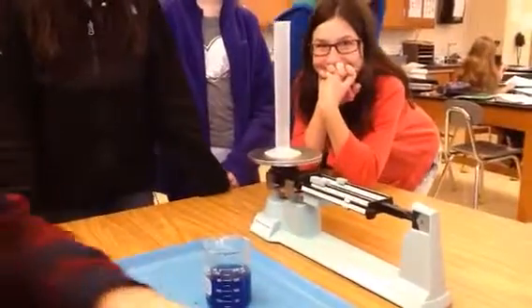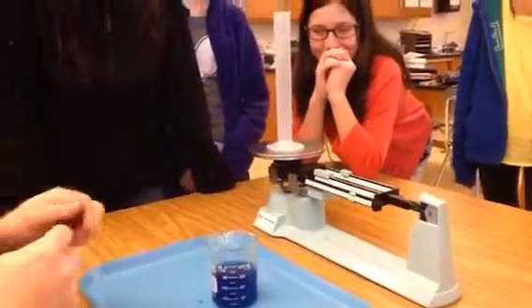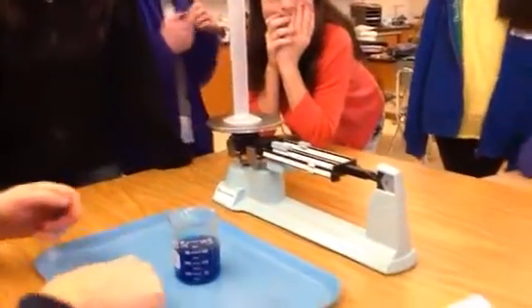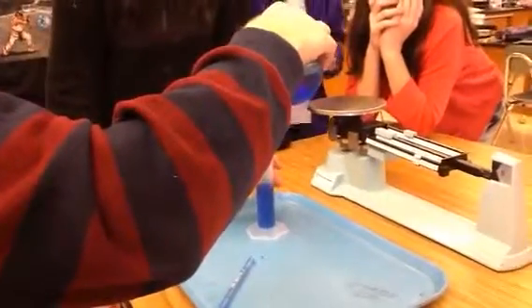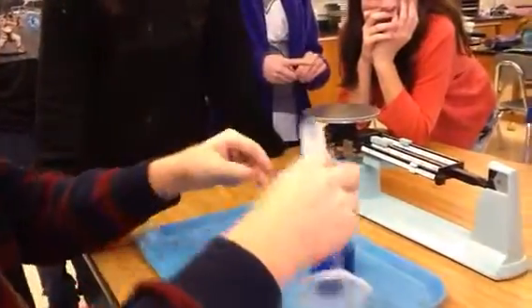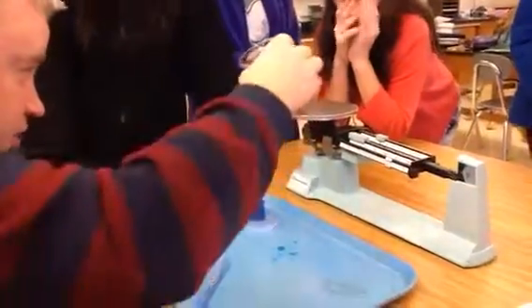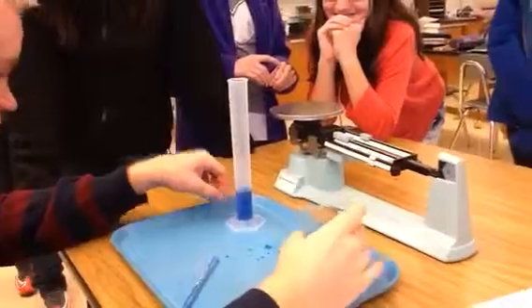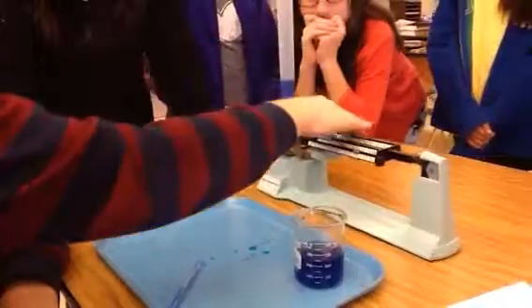Up on the board, we're going to have the same thing in a minute, so I'll go along with it when we show the video. So I'm going to write 37.7 here, and then I'm just going to pour the amount of water in here, and then we're going to put it back on the scale. What are we going to do with those two numbers, everybody? What did I just do? I put way too much in. I spilled just like I do at home. So here we go. Good. So that's 25.